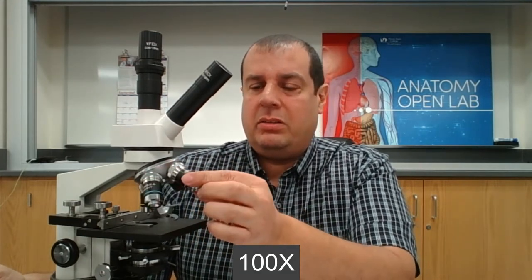The rotating nosepiece will rotate through the different magnifications, and each magnification is located in one of these structures, which are called objective lenses. This one is 100x magnification, this one here is 40x magnification, this one here is 10x, and then here you have the least, which is 4x magnification.